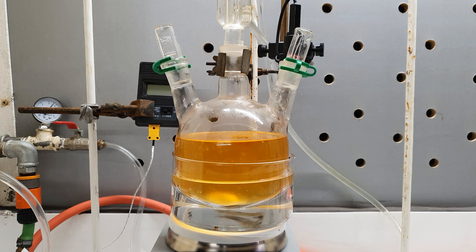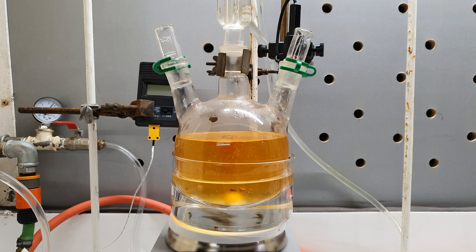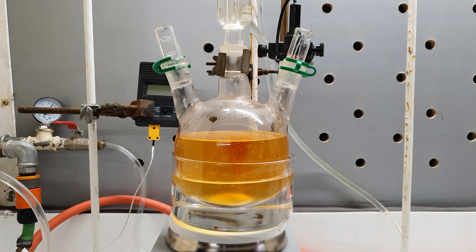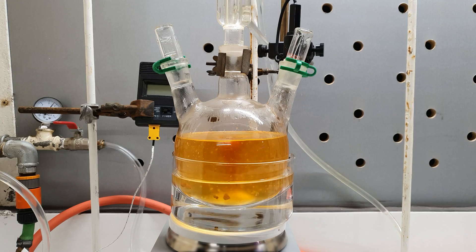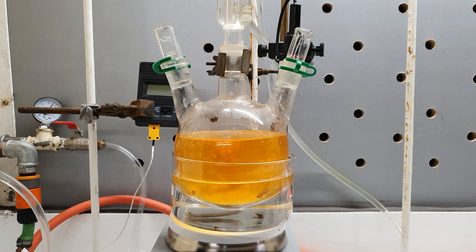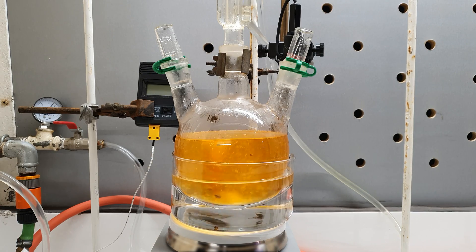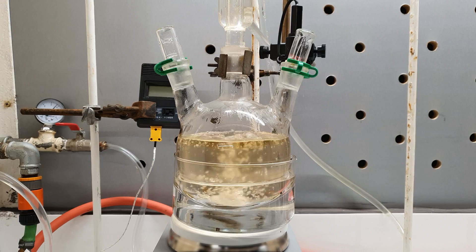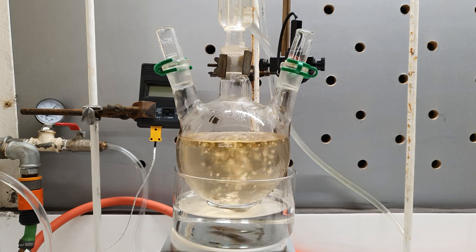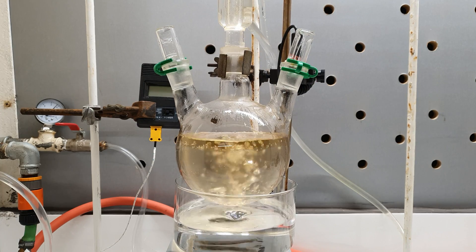Soon enough, oily drops started to form in the flask — you can see it as the darker color inside the vortex. This is our product, bromobutane. It has a darker color because it is a better solvent for the bromine and extracts it from the water layer. After three hours the solution decolorized, and you can clearly see the top layer of bromobutane.